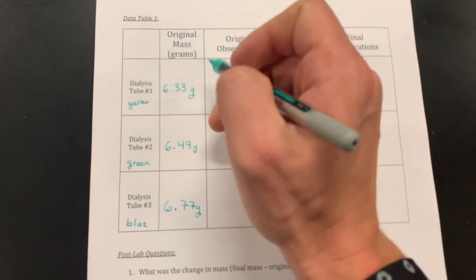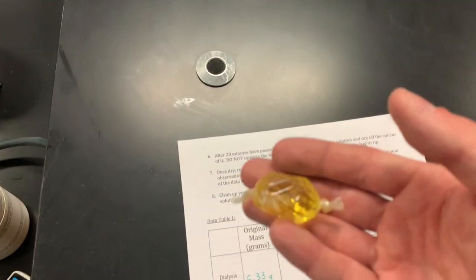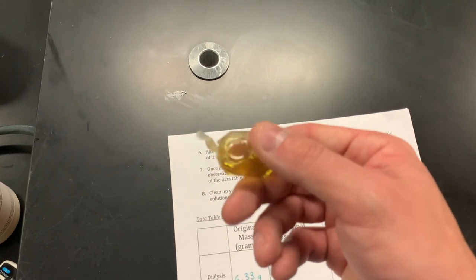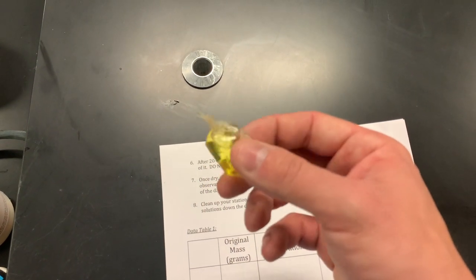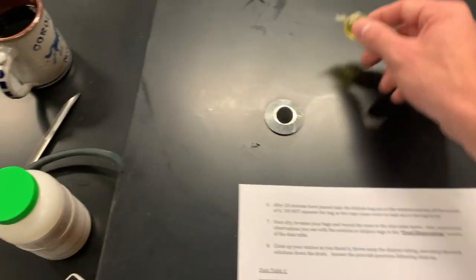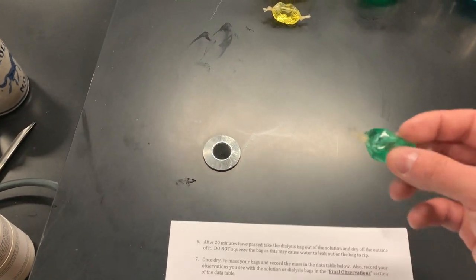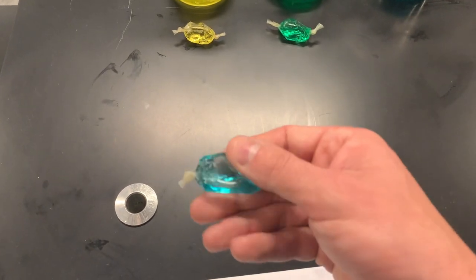Original observations: obviously the yellow one is yellow. There is a little bit of give in it — it's slightly pliable. The liquid is not very firm against the outside. Same thing with the green — the liquid is not very firm against the outside, and it's obviously green in color. The blue one is the same: the liquid is not very firm. That might change after osmosis has occurred.